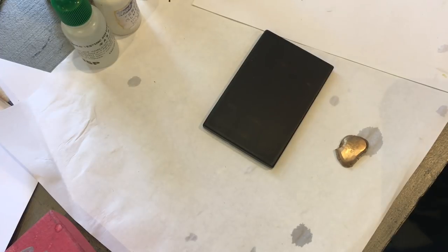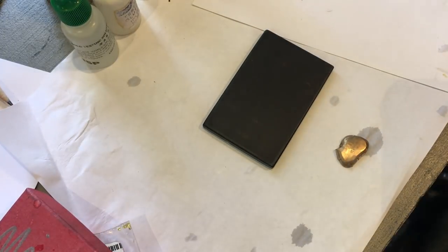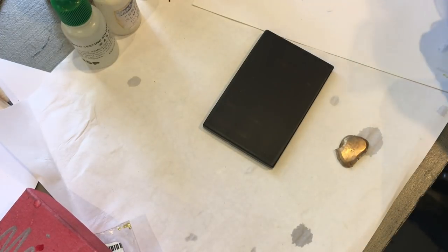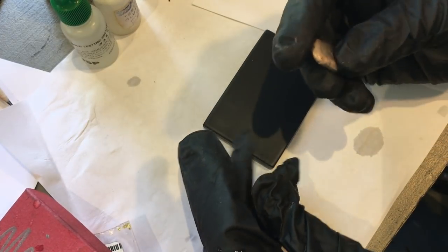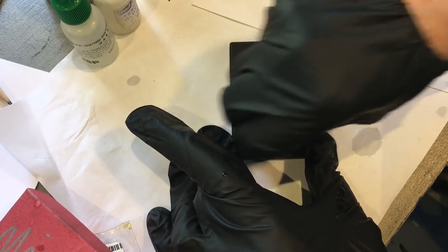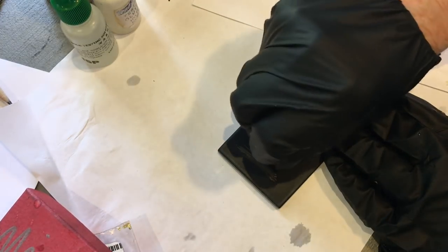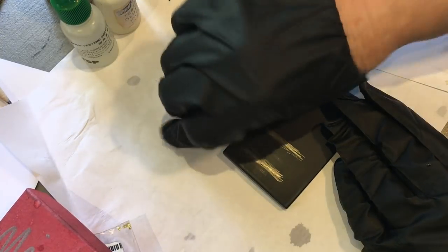I have this nugget thing. I don't remember when I made it, but I know it didn't work very well when I tried to roll it out — it cracked, so there are probably some impurities in there. I'm going to refine it and see if they can remove the impurities and give me money for it. I'm going to rub it really hard on the stone making a stripe, and then I'm taking this ring and rubbing it on too.